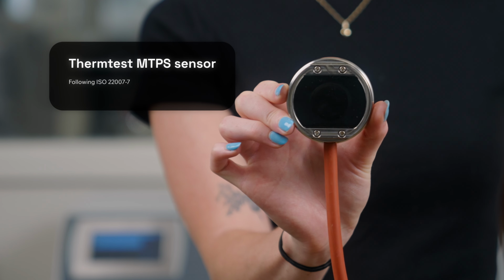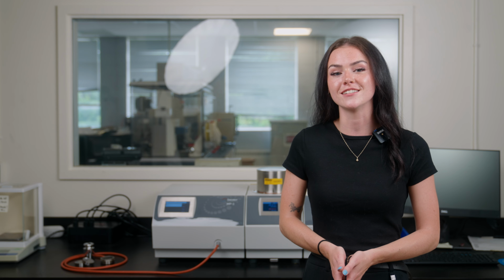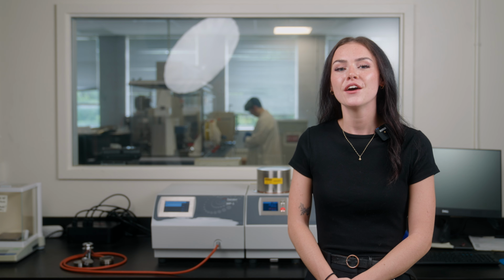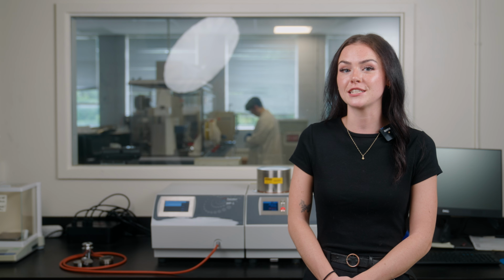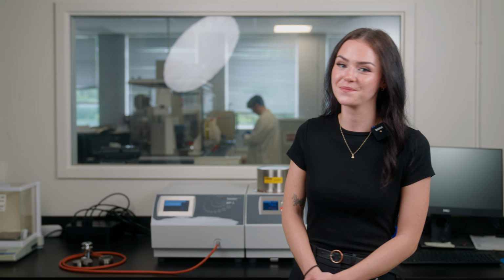Again, we're using the Thermtest MTPS sensor following ISO 22007-7 to measure thermal conductivity at different timescales, investigating metals for homogeneity. Stable thermal conductivity at different penetration depths would suggest that the sample is homogeneous. We are going to use the same testing schedule built in part 1 for testing the 3D printed parts and the identical sample setup. Now, we're going to walk through the basic sample setup of the MTPS sensor.